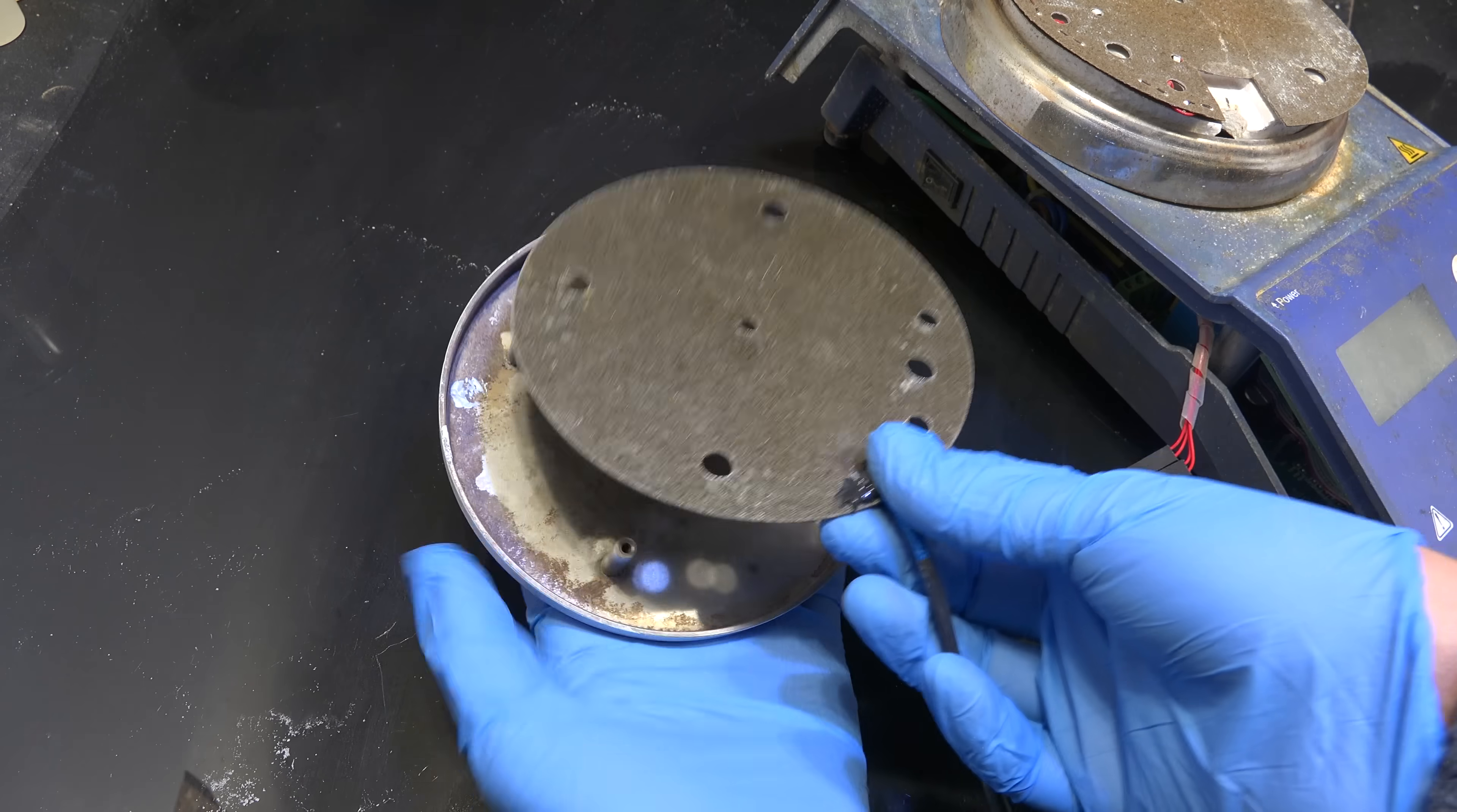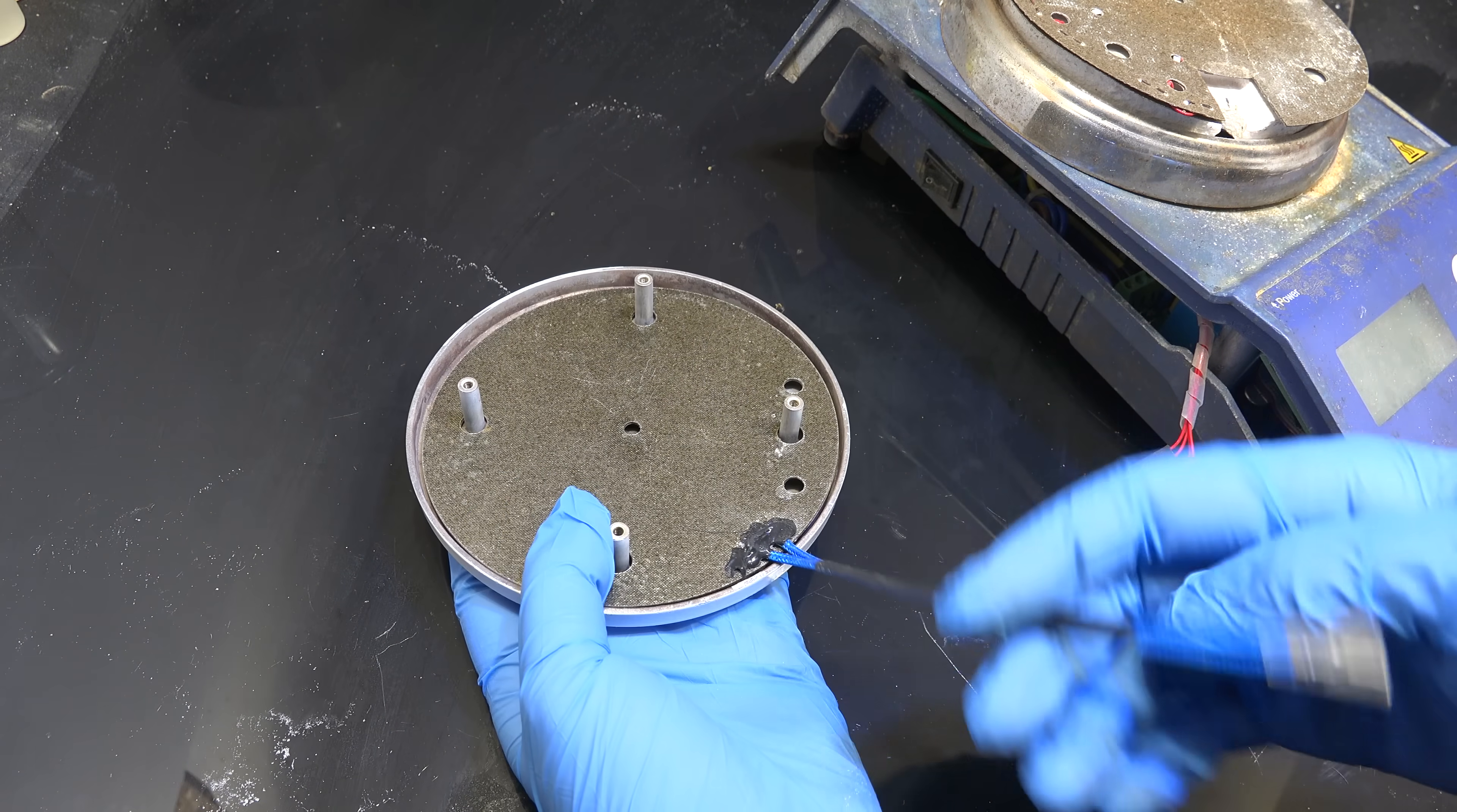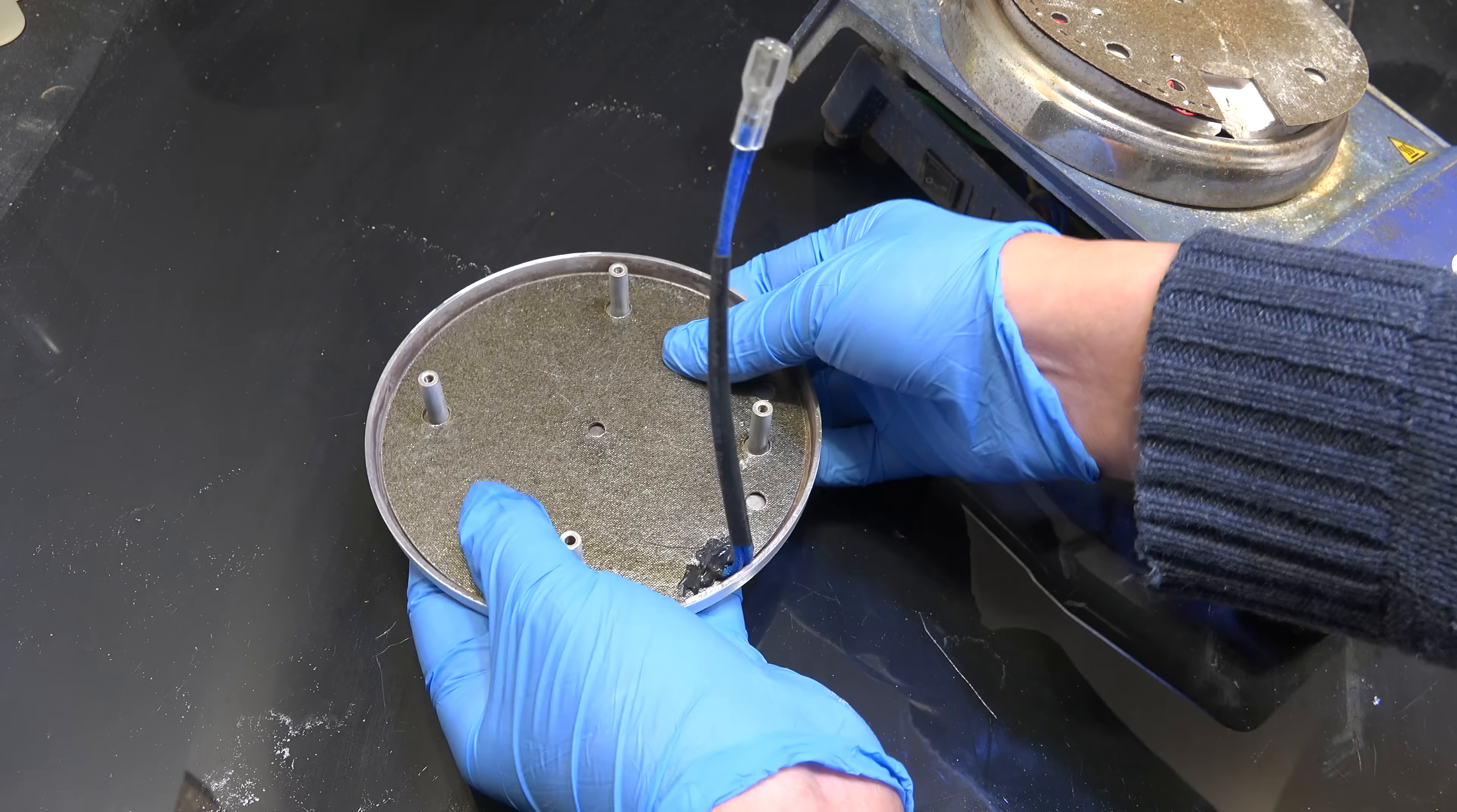Now a few years ago I was having huge problems with the heating elements and I was able to replace them with some very robust elements I purchased from China. That same element that I put in those years back is still working. We've now reached the point where something else is breaking inside the hot plate stirrer.